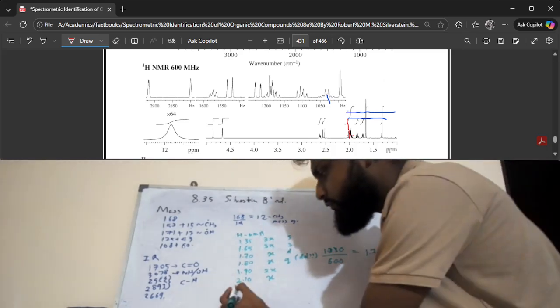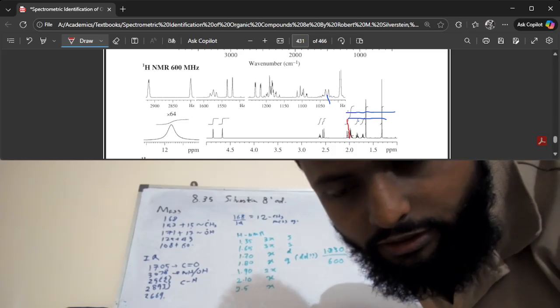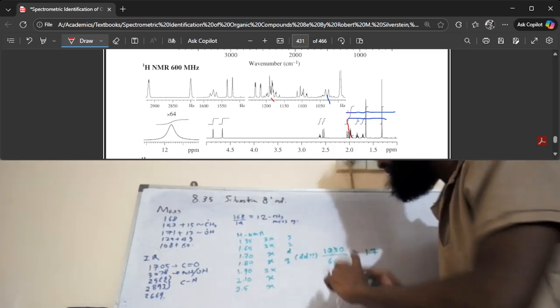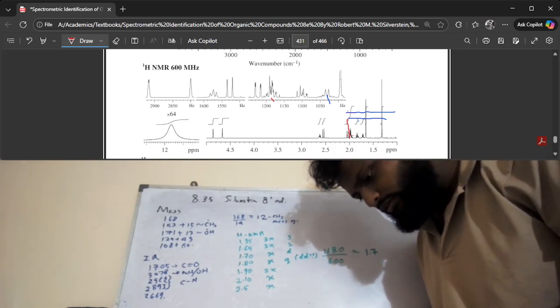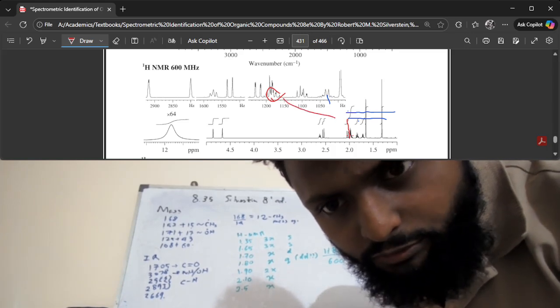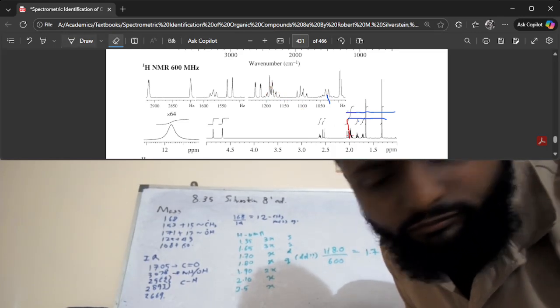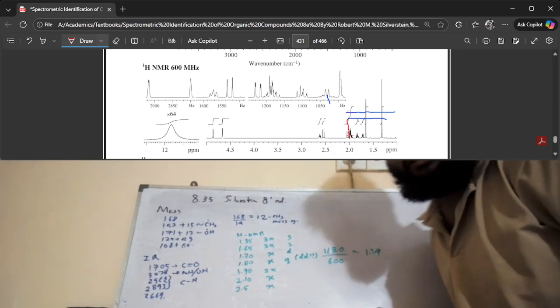So we have another peak at 2.5, which also corresponds to 1x. Oh, we forgot to mention the multiplicities of these things. Here you can see it's about 1180, let's say. Let's do the same math. You could just assume what each of those peaks mean, you could connect these peaks by assumption. But it's always better to do the calculation and be sure that you're connecting it properly, because if you don't connect it properly, you're definitely going to get it wrong. So it's 1180 over 600, and that comes to around 1.9. So that peak corresponds to that.